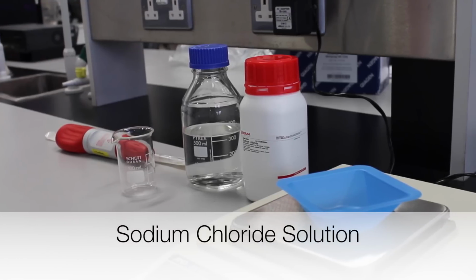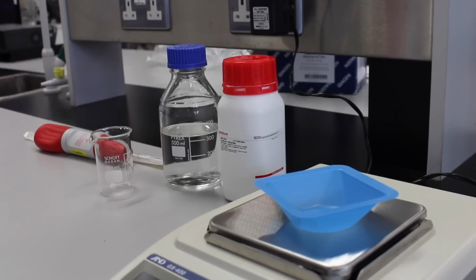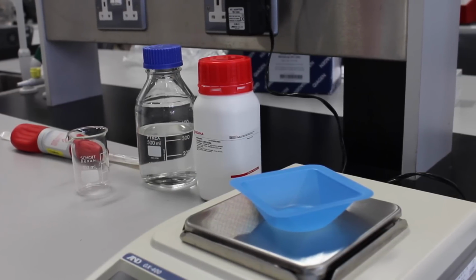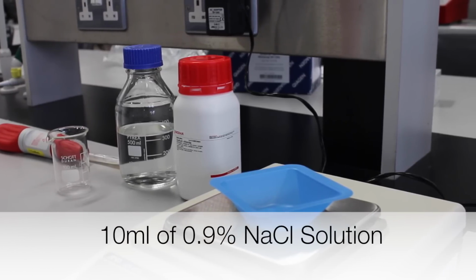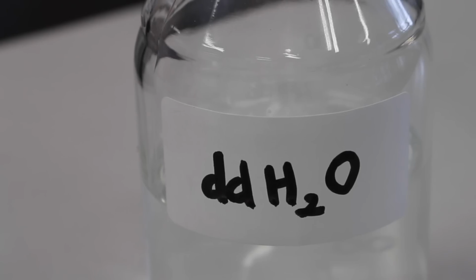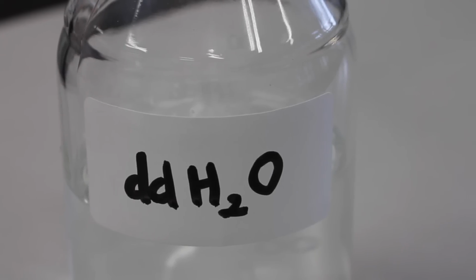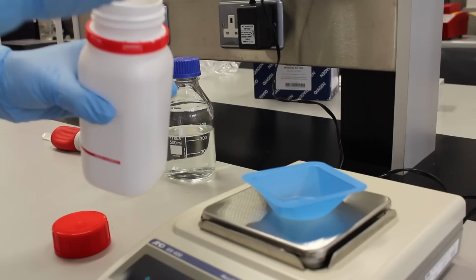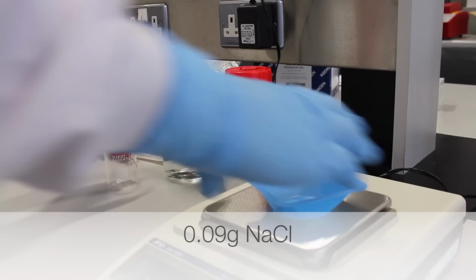First, the sodium chloride solution will be prepared. This solution is used during experiments in order to prevent osmosis, which damages the cells. In this example, 10 milliliters of 0.9% sodium chloride solution is prepared. For this, sodium chloride salt and doubly distilled water, which will be referred to simply as water in this video, are needed. To make up 10 milliliters of 0.9% sodium chloride solution, 0.09 grams of sodium chloride salt is weighed out.